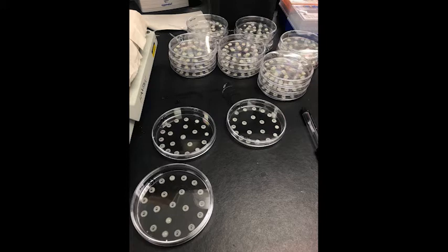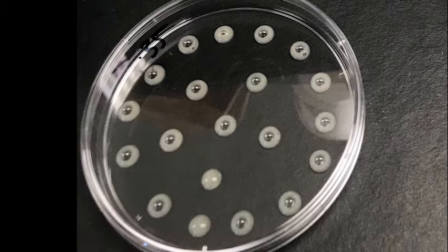Here we can see another close-up of some slightly younger larvae that are still floating there on top of the diet. Here we see some where there's actually some variation in the size of the larvae. This is from an experiment where we weren't as tightly controlling the age from which we grafted the larvae. You can see some are clearly larger than the others. They're probably about a day older. Most of them are around the same size, but in the middle there you see a much larger one. If we're doing an experiment, we would probably remove those ones at this stage because we don't want that age variation in there.